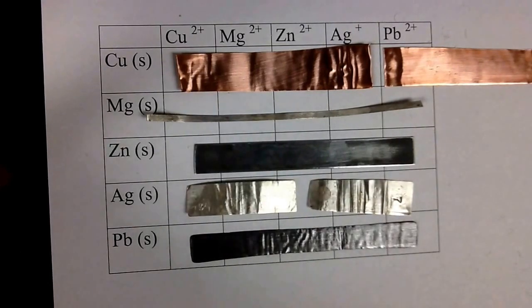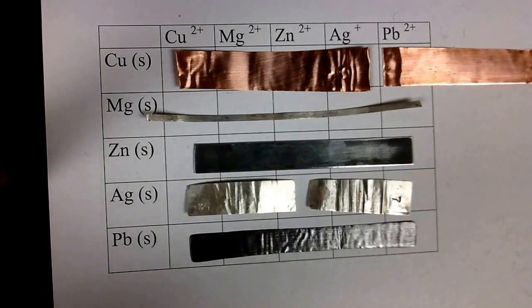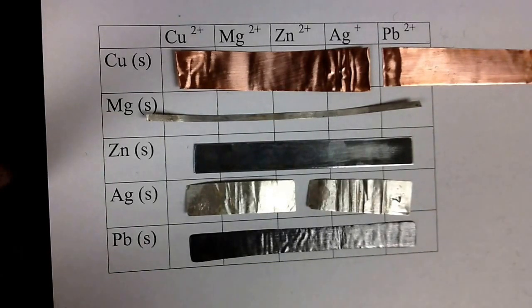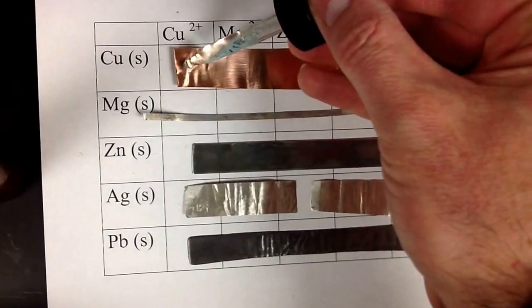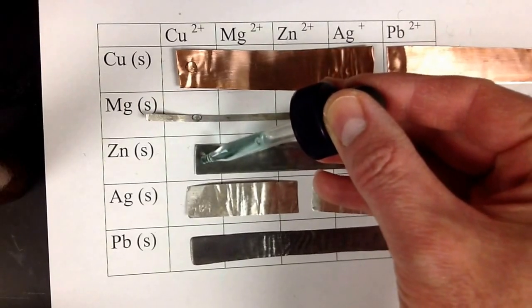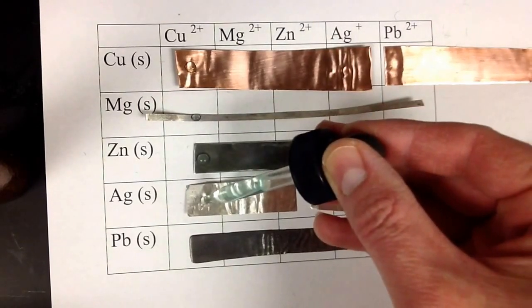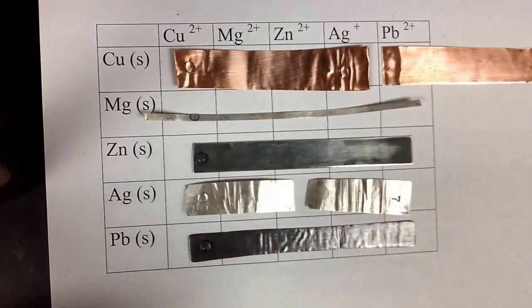So the first thing I'm going to do is I'm going to put some copper, one drop of copper ion on each of the metals. And so if we have a reaction, what that's going to tell me, or how am I going to know that is that most often we're going to look for a color change. So a color change is a really good indication that you have a chemical change, and this color change should happen pretty quickly. Sometimes it does take a little bit.